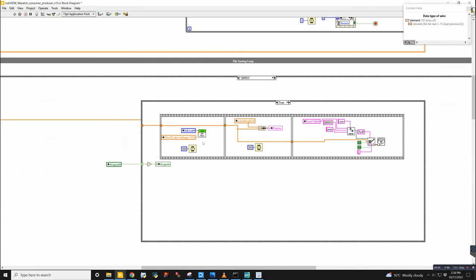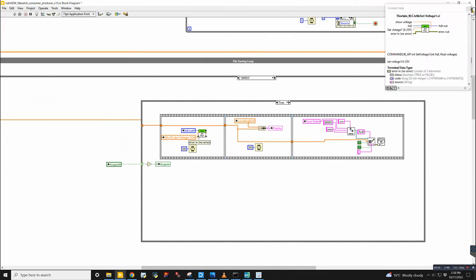So does this actually work? Yeah, it does. Because you're taking a spectrum that's taken before you change the voltage setting, right? Yeah, I see that right now. And then it puts that in here. It will save 2 spectra every time, but the thing is whether it's the right 2 spectra. I see. So the first step that needs to happen is you need to go to the minimum K cube voltage, and then you take a spectrum, and then you change the voltage, and then you take another spectrum. Yeah. So that needs to be the order.